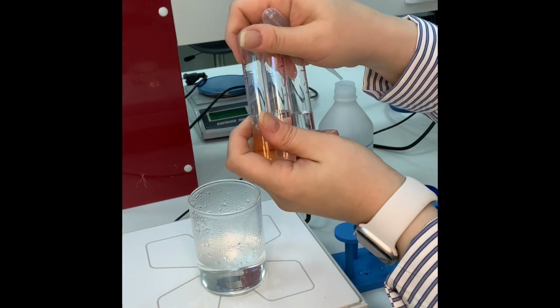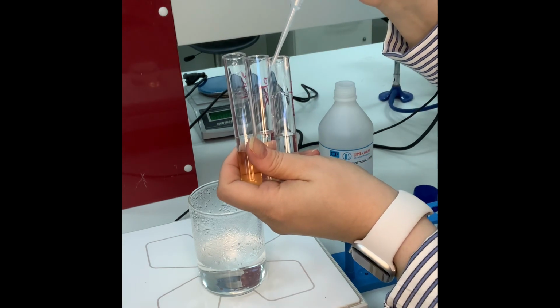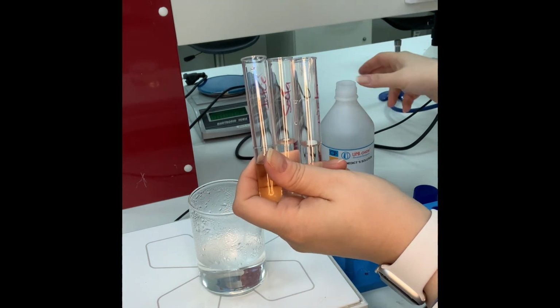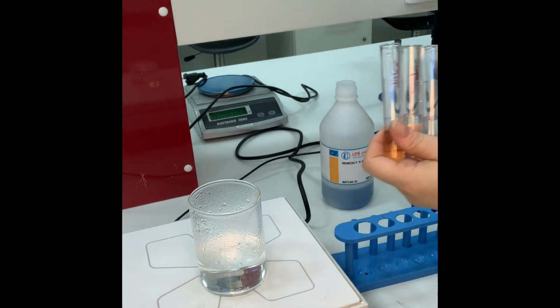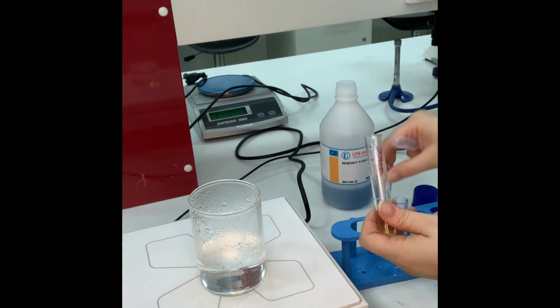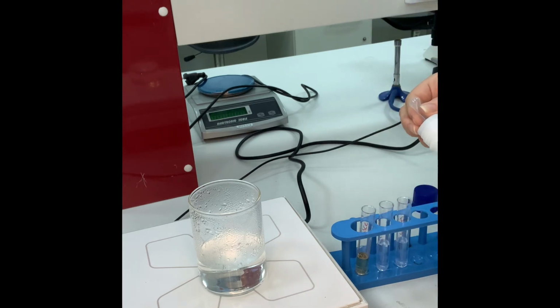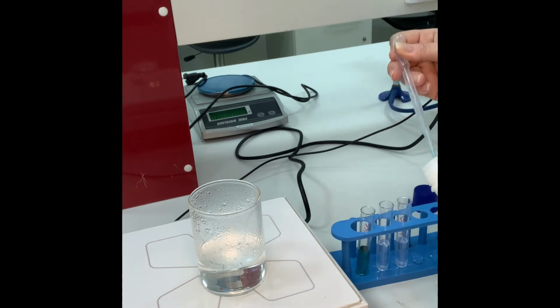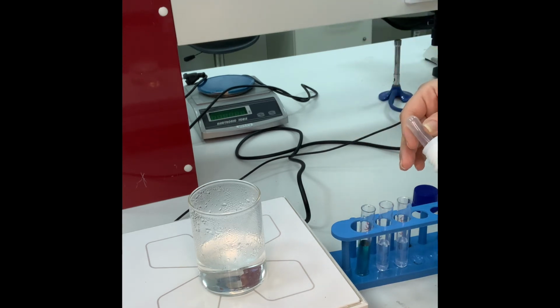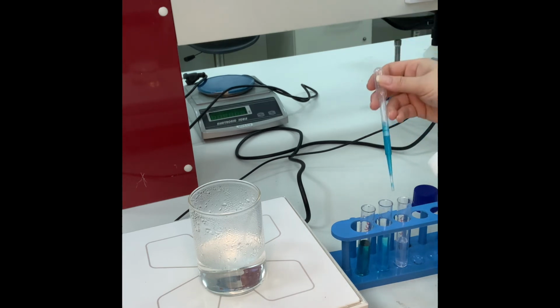So I'm just gonna use those test tubes over here. This is juice, this is soda, and this is water. Soda, 7-Up. Oops, just a second, it went down. Here, this is much easier. So I will have 2 full withdraws in order to have 2 milli of sample and 2 milli of the reagent.